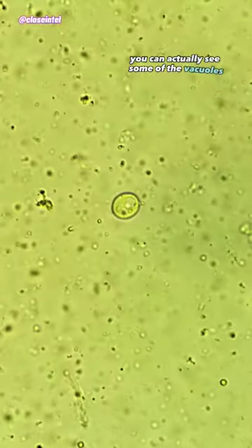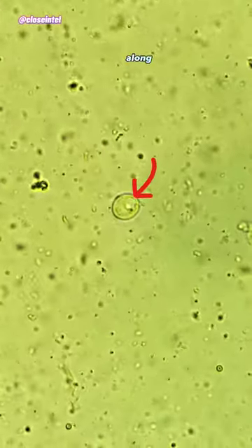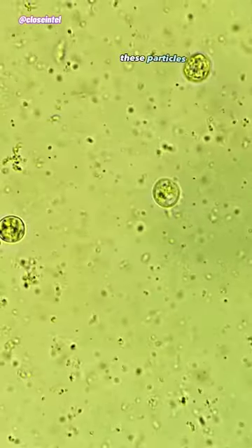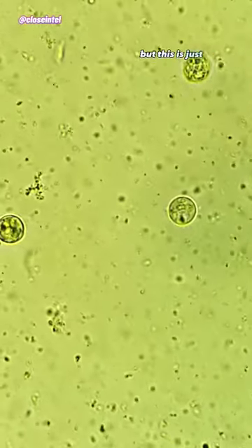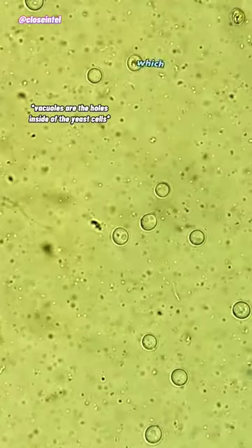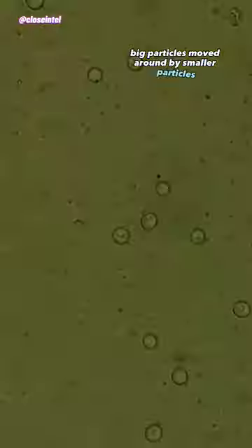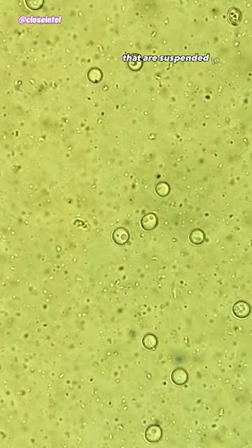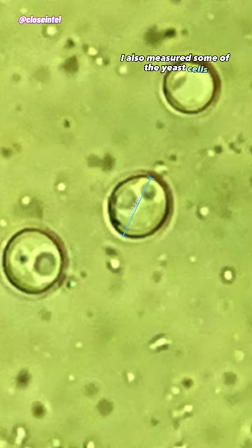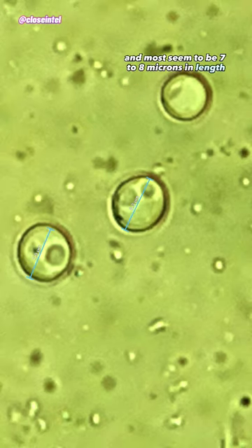You can actually see some of the vacuoles inside of the yeast cells here, along with a bunch of other particles floating in the background. These particles may look like they're moving, but this is just a phenomenon called Brownian motion, which is basically big particles moved around by smaller particles that are suspended in a liquid or a gas. I also measured some of the yeast cells, and most seem to be 7 to 8 microns in length.